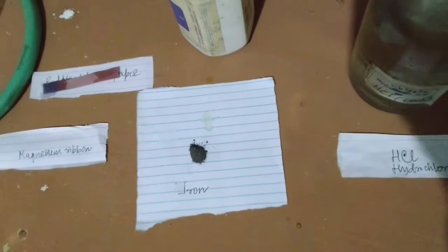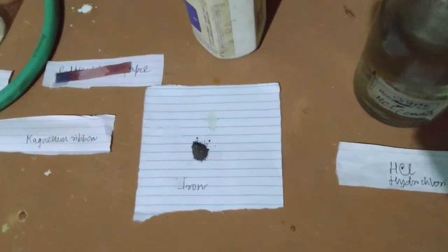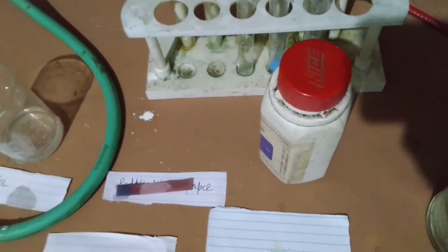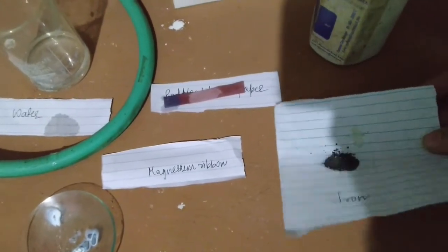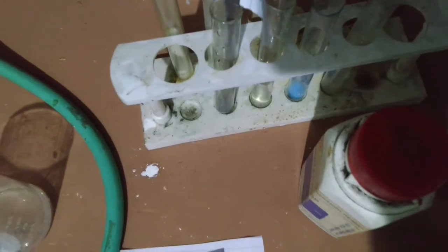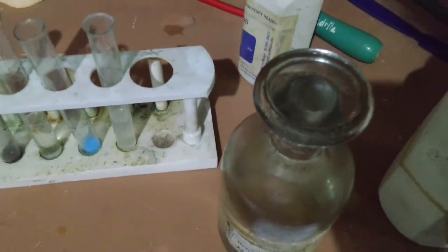So I am taking an iron. So let's take a dry test tube. Since I am working with one hand, it is impossible. So here you can see I am taking a test tube, and instead of a spatula I am just going to add directly. Okay, so add, this is hydrochloric acid. Now I am going to add the hydrochloric acid drop wise.